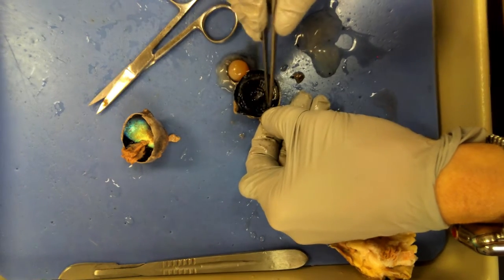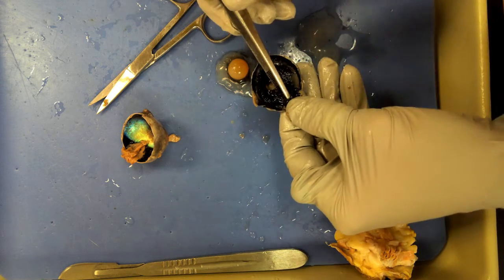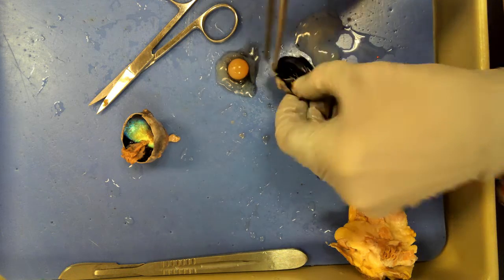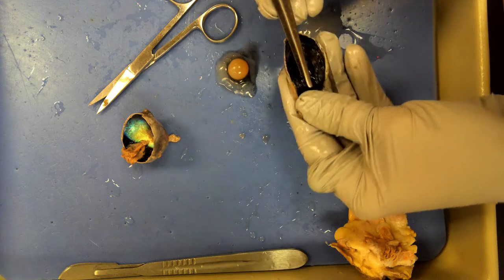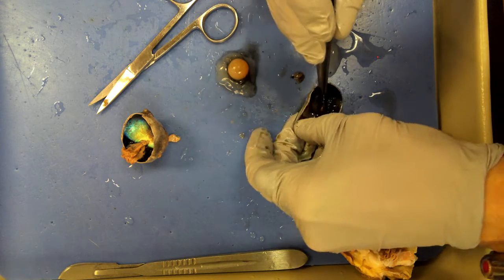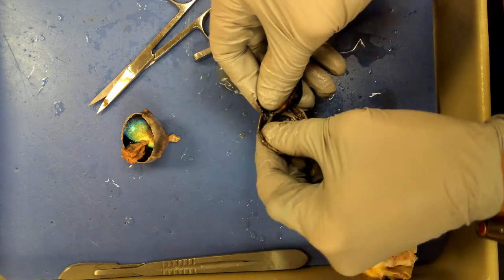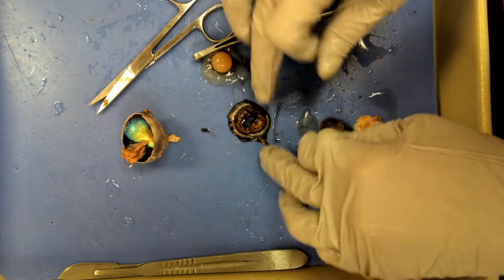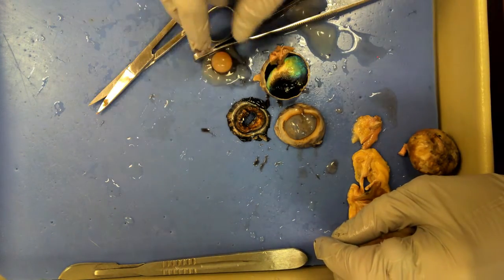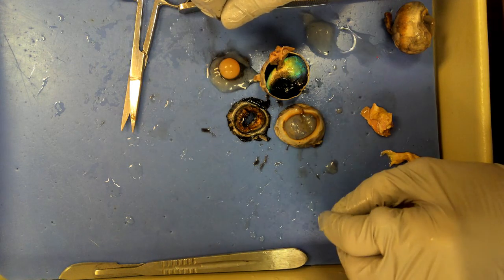You can barely make out, because of the video quality, these little indentations. This is the back of the iris — there's the pupil and here's the cornea again. Now I'm going to take the iris out, which I try to do with my students but sometimes it's not tough enough. If you carefully do it, it'll just peel away. That's what's so interesting about the eye — it's in layers like an onion. Now you can see into that sheep's cornea. That concludes our journey into the eye of a sheep. Hope that helps you guys, bye!